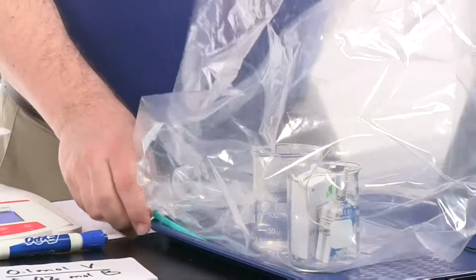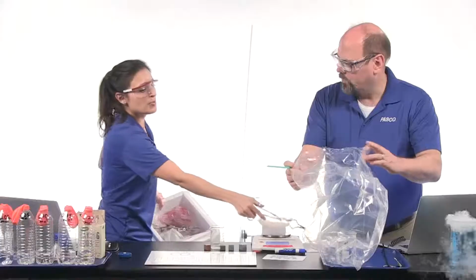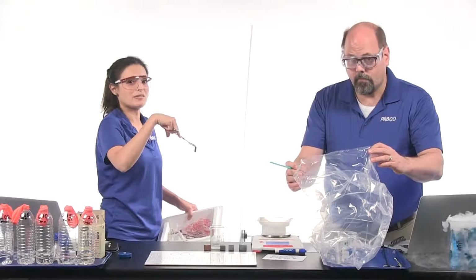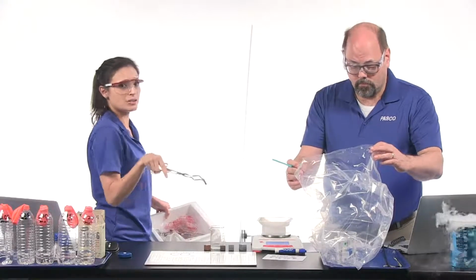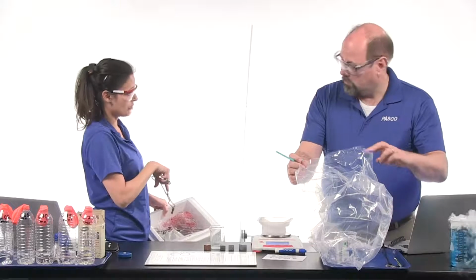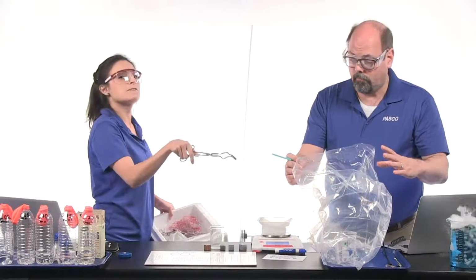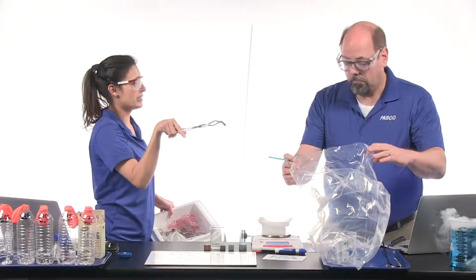So JP's computer, we're going to be measuring the pressure and temperature change over time when we drop the dry ice into this beaker. In a minute, Roger's going to take all of the air out of the bag so that we can be sure that anything contributing to the pressure and temperature is just CO2. Yep. And we'll monitor pressure and temperature. It'll take a few minutes, so we'll just leave it going once it gets going.